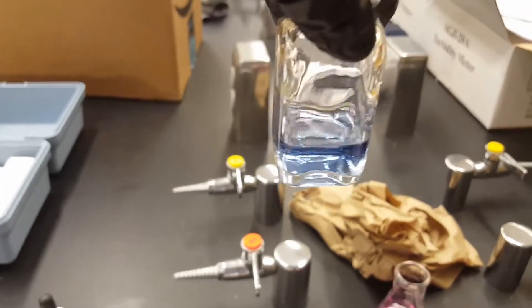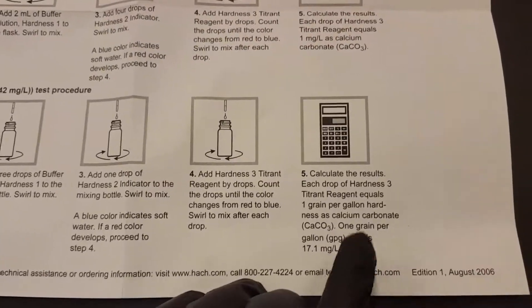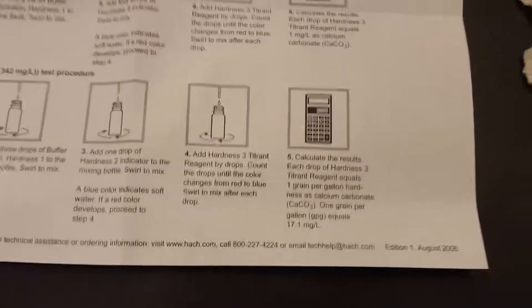Once you get the number of drops it takes to turn blue, you'll do your calculations in step five. Very simple. And that is it.